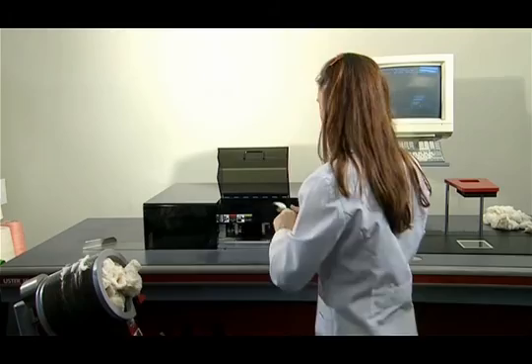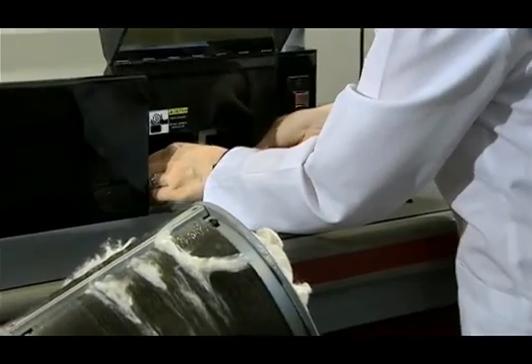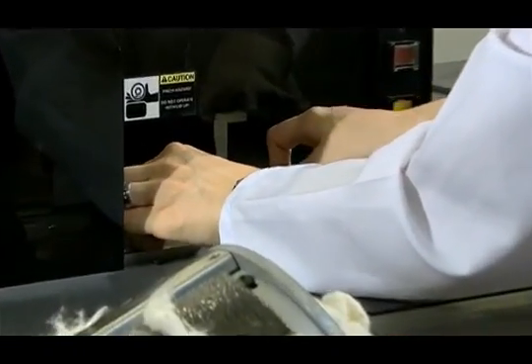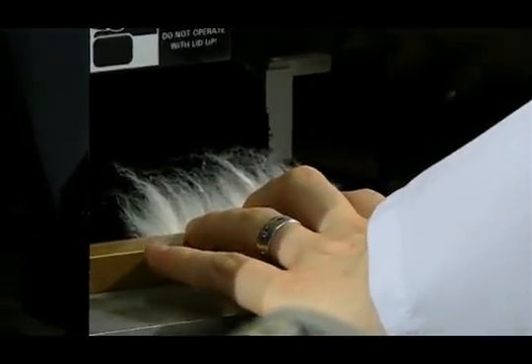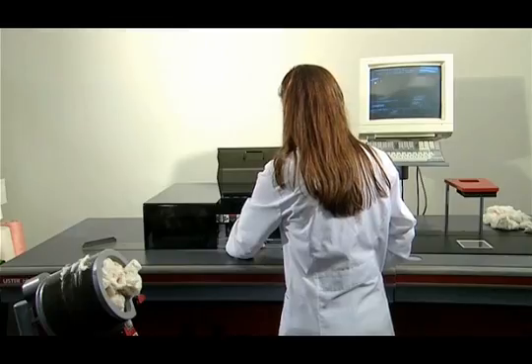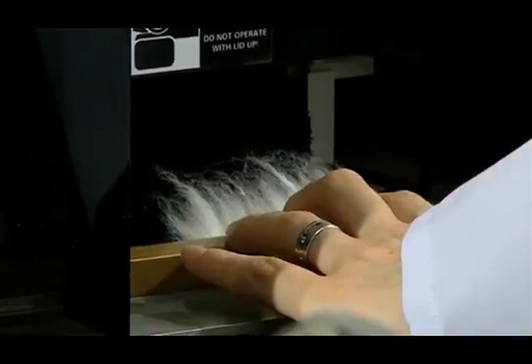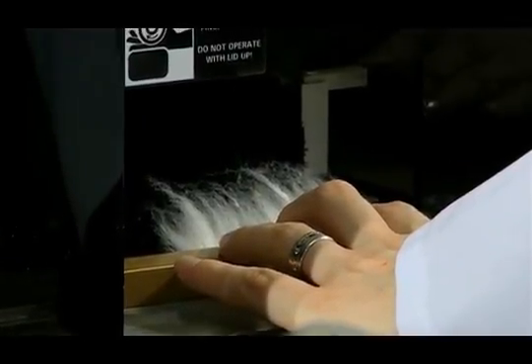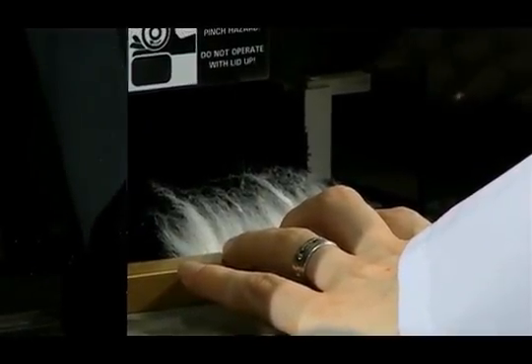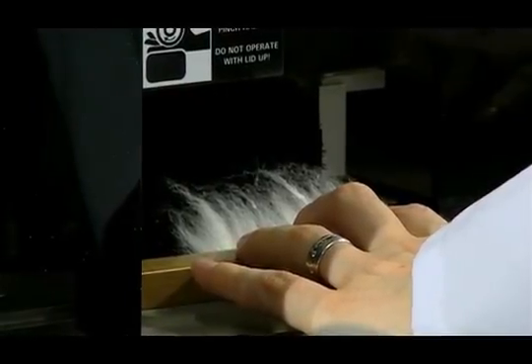I place the samples on the length measuring section of the device. While fixing the holder with one hand, I push the button with the other hand in order to make the brush come. This brush will remove any excess and irregularity on the fiber and will send the sample to the middle area to have it tested.